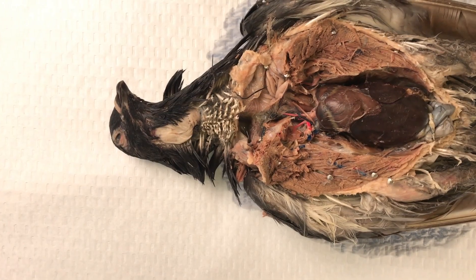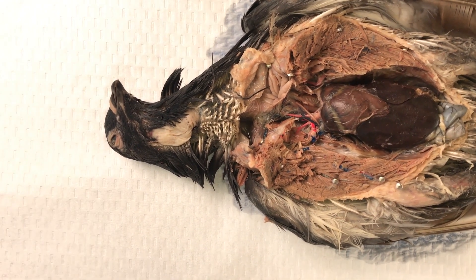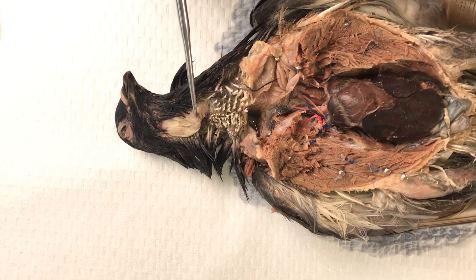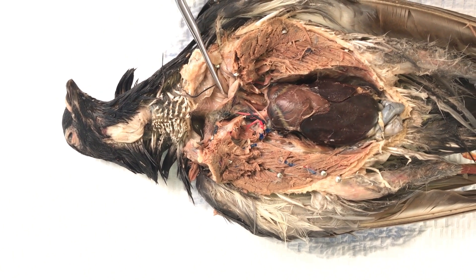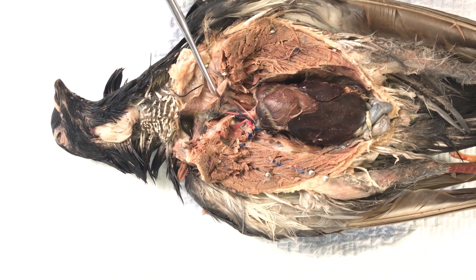With that space open, you can see how food travels from the bill down into the storage area of the crop, and you can see how the crop connects down to the gizzard.